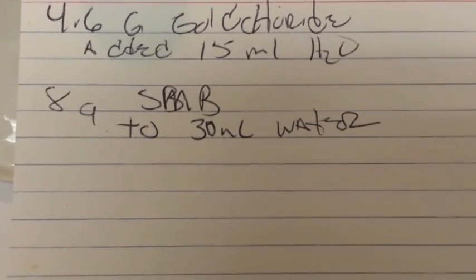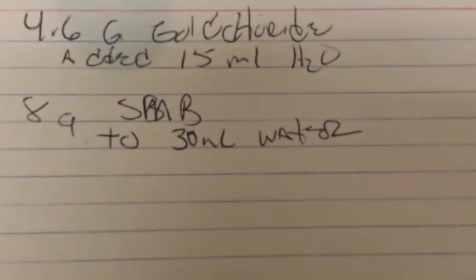Today we're going to make gold. Specifically, 2.3 grams of gold.